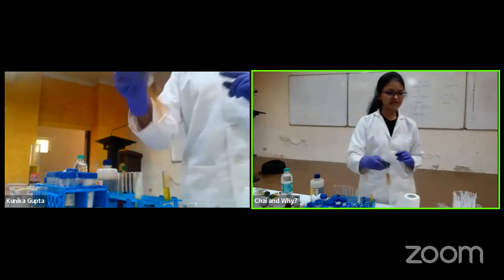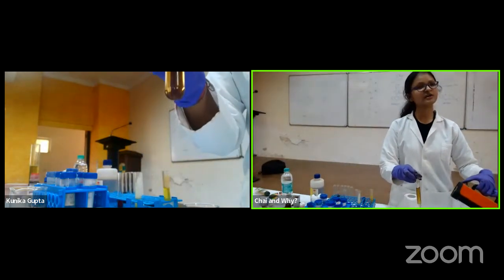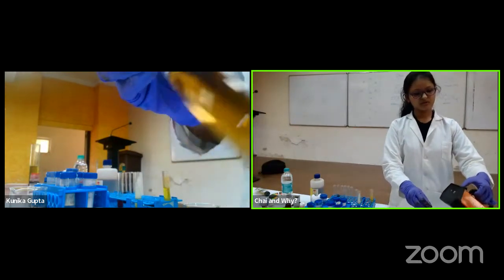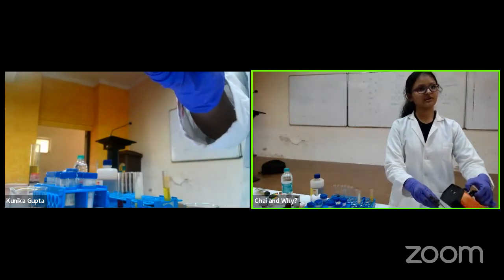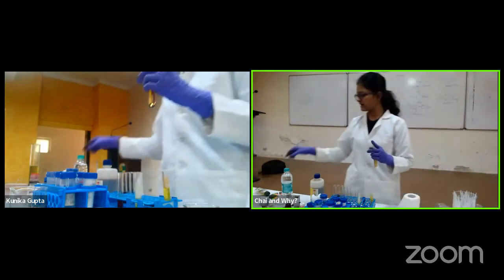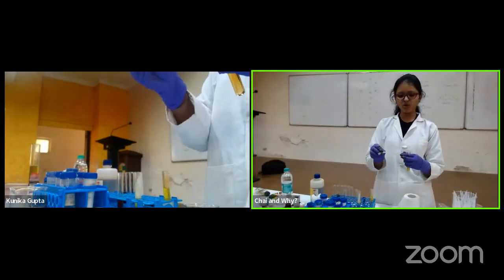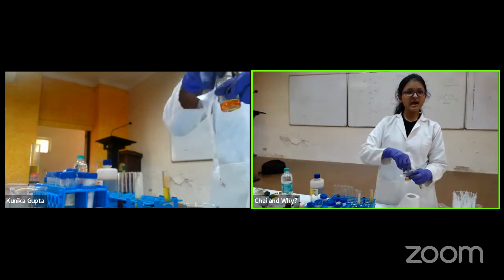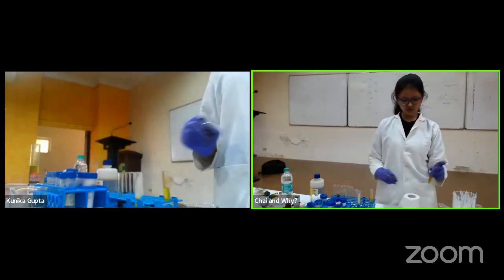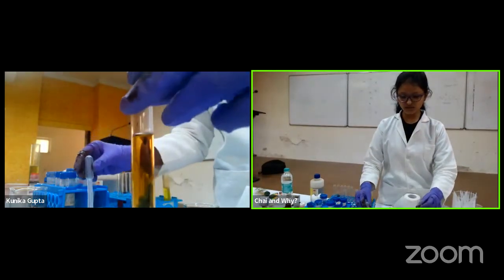So at every step I will show you under UV, so that when there is a turn on under UV, you won't think that it was already there and I just showed it as formed. So there's no response. Fine. There is no change at all, which is expected. Now I'll add something to which it will react. It is something called bromoacetyl bromide, to which it reacts. And this reaction gives you a formation of porphyrin. What porphyrin is, it actually is a structure.